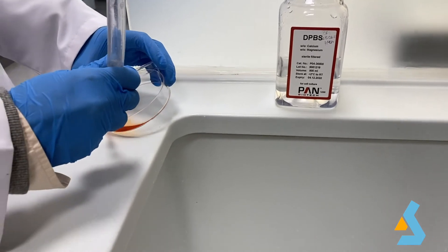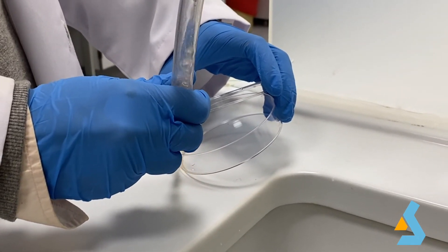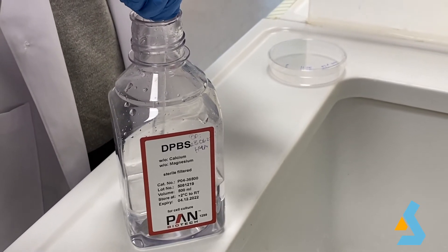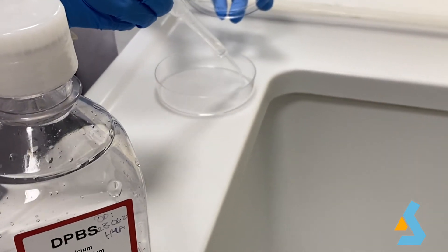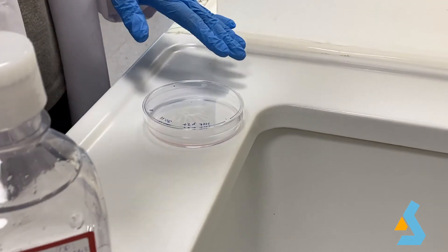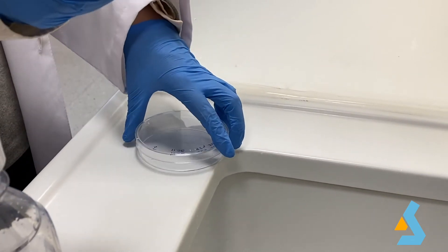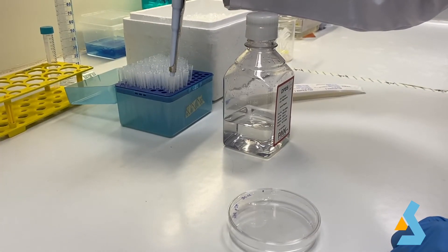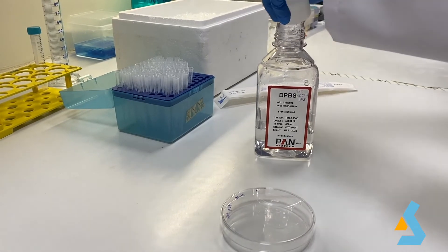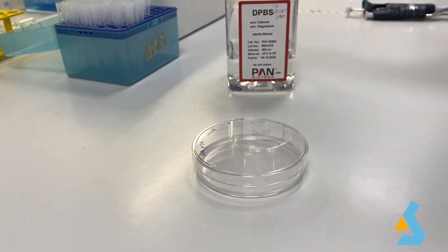Now we will do protein isolation from HEK 293 cells. First, we need to remove the old medium in which the cells were growing, and then we need to wash the cells with 1 milliliter PBS. After this washing step, we add 1 milliliter PBS and start scratching the cells from the plate.